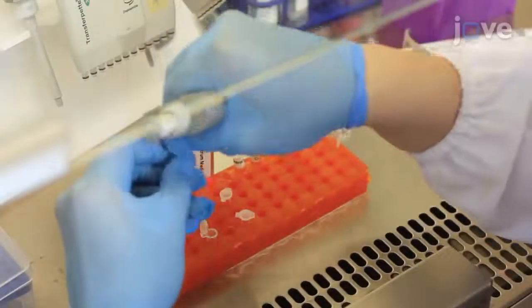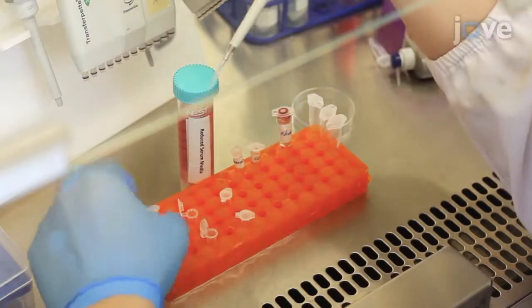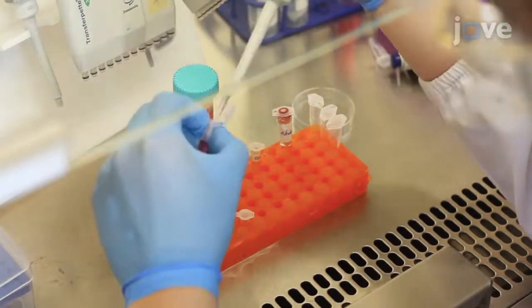Then, dilute 5 microliters of liposome reagent in 250 microliters of reduced serum media and incubate for 5 minutes.